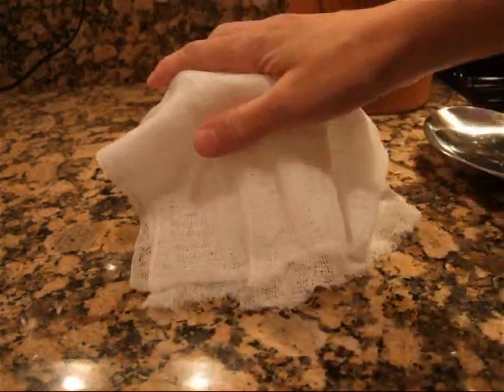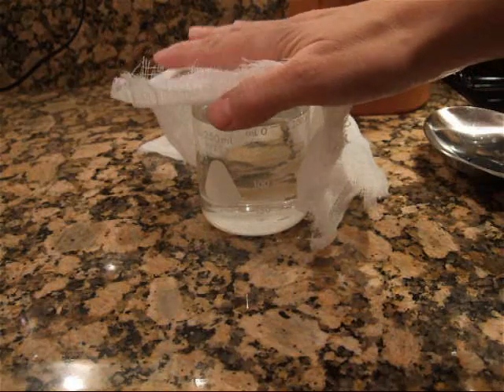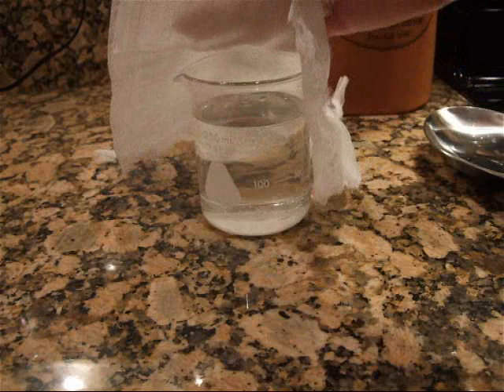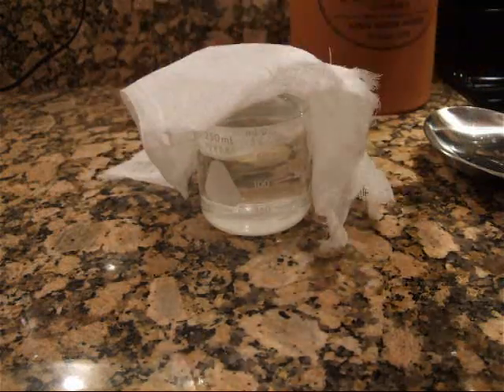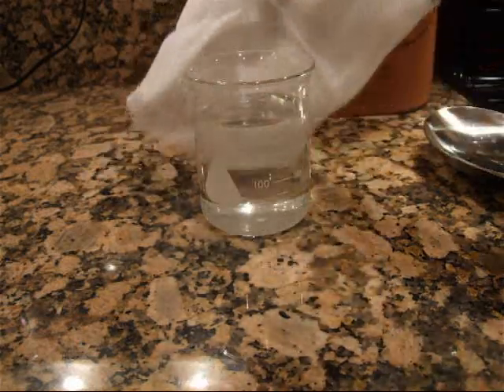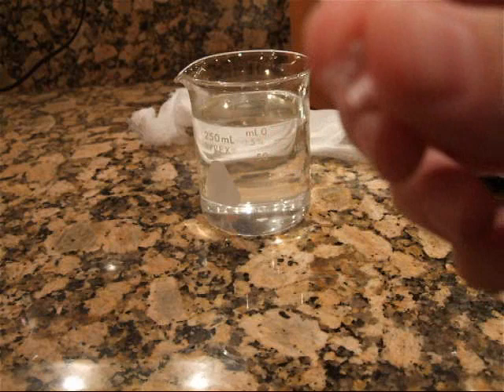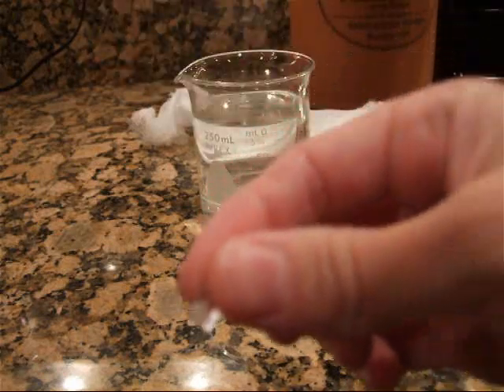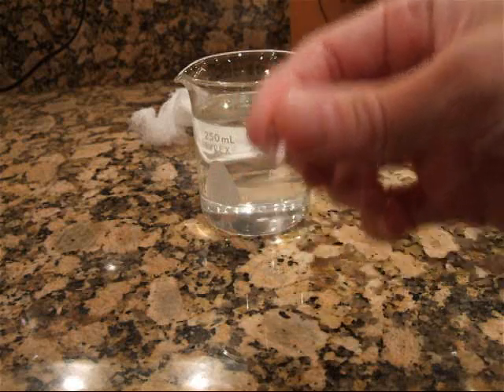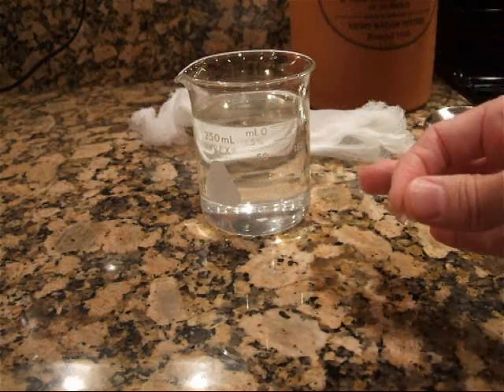So to recap: I have the cheesecloth over the cooled solution. This is a super saturated solution — we have the sodium thiosulfate pentahydrate saturated in that solution. I heated it up almost to boiling and took it off the heat. I've got a little pellet here of the sodium thiosulfate, the photographer's hypo. This is going to be seeding the super saturated solution. We had a heated solution and then it naturally cooled, just like it would in nature.